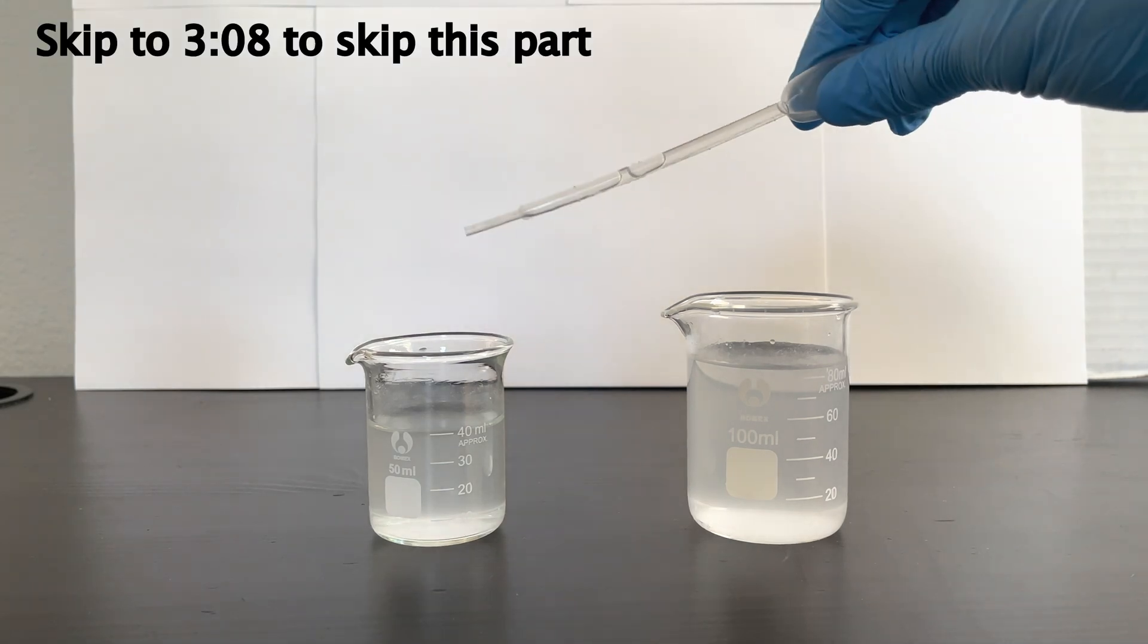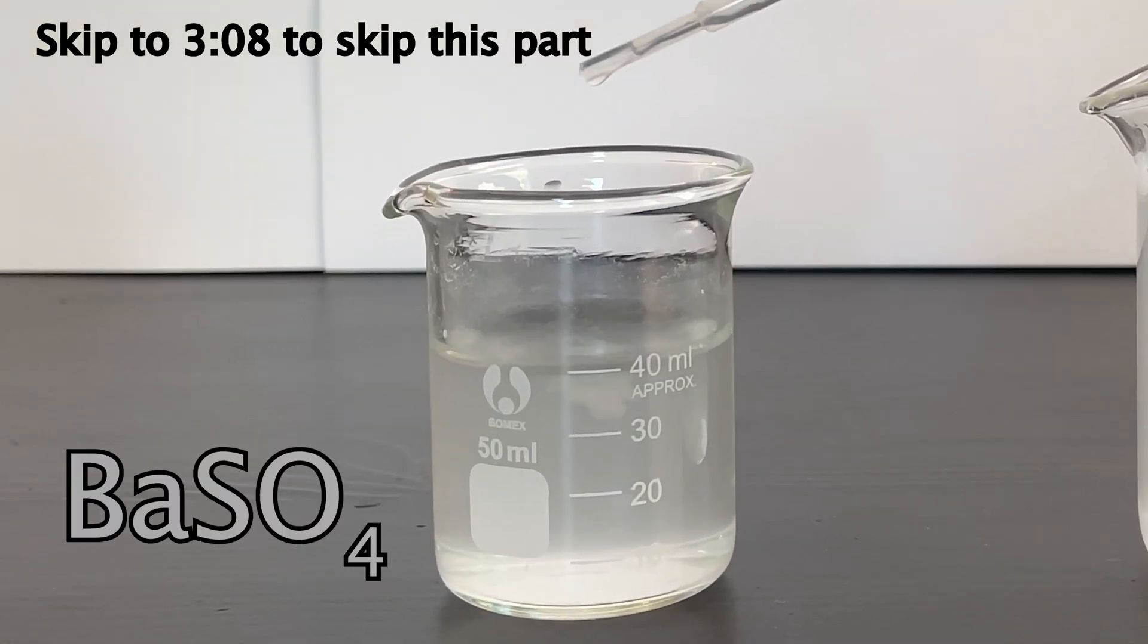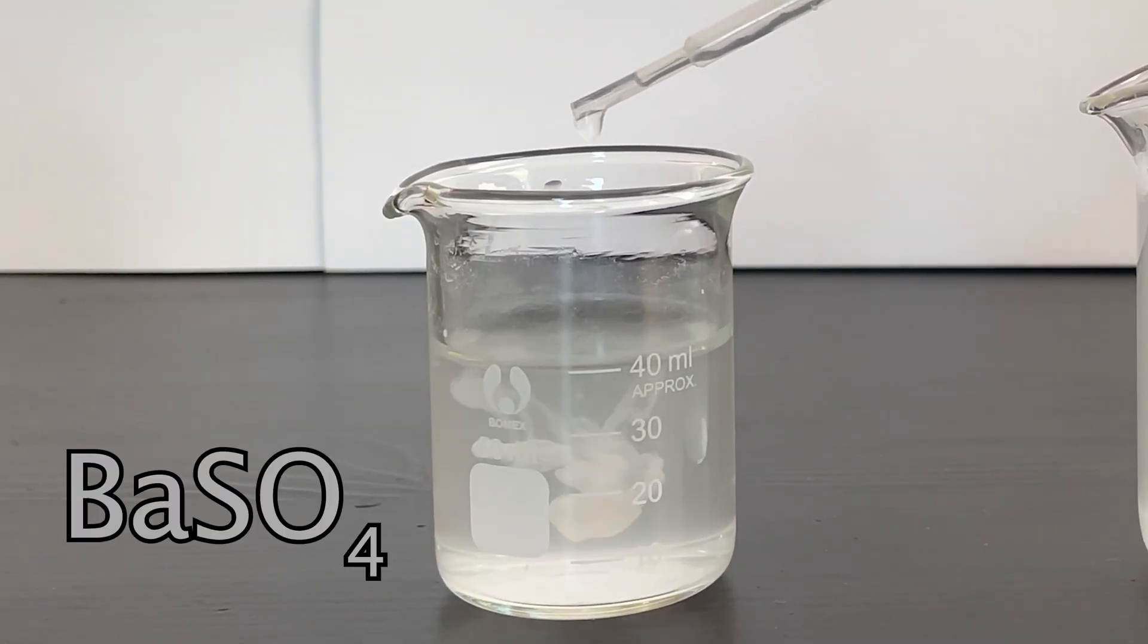Here's a different video of me doing the same thing, where the precipitates are just a bit easier to see.